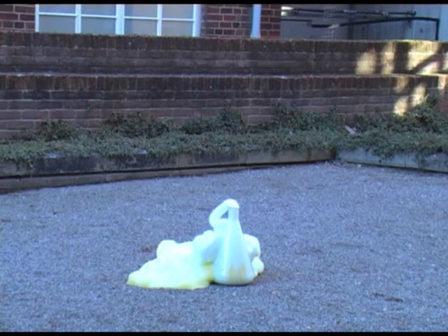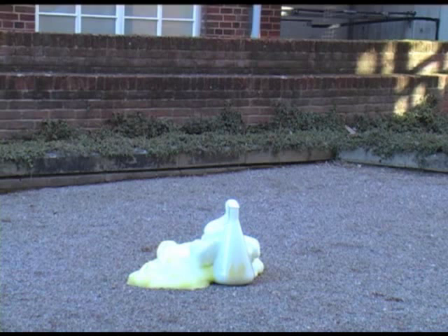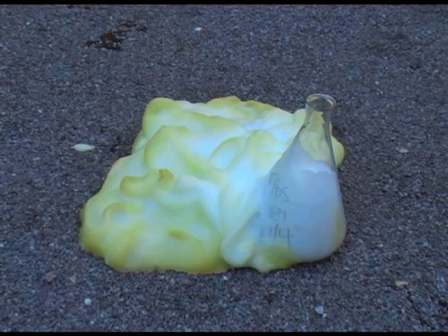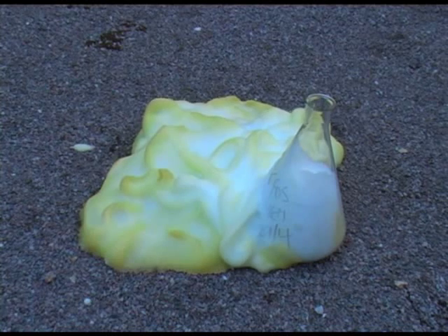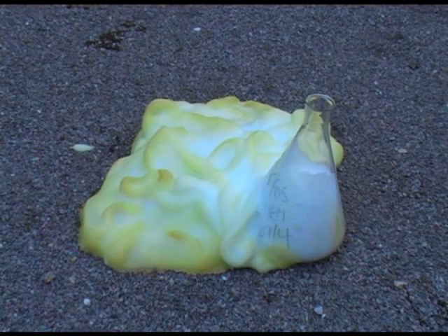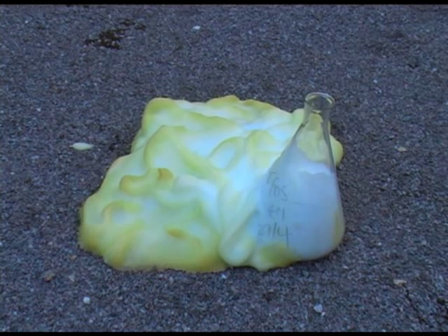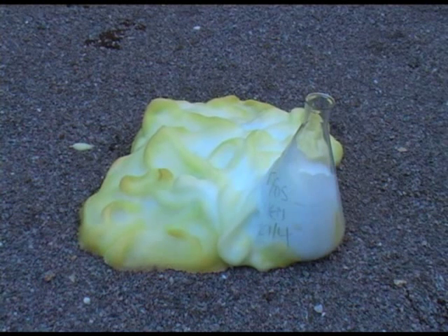Eventually once all the hydrogen peroxide is decomposed no more foam is produced. And just to emphasise what we've already said: when you see fizzing in a reaction this is because a gas is produced, and as the gas bubbles out of a solution that causes the fizzing that you can see.